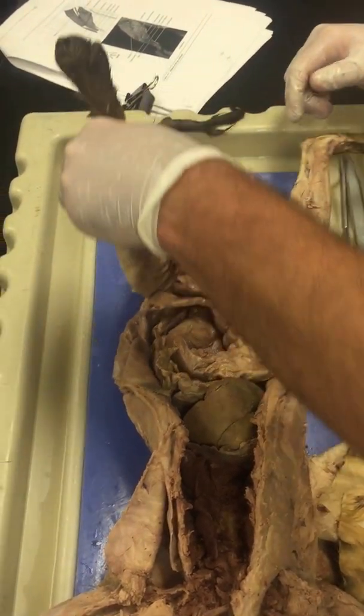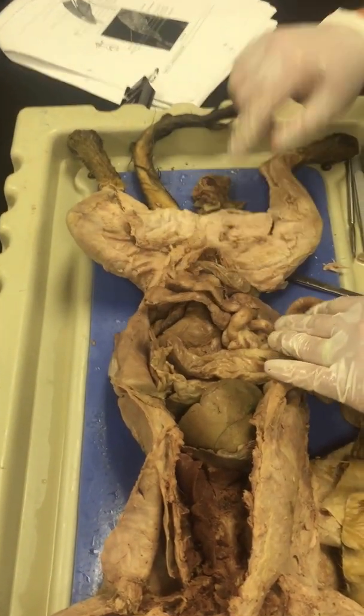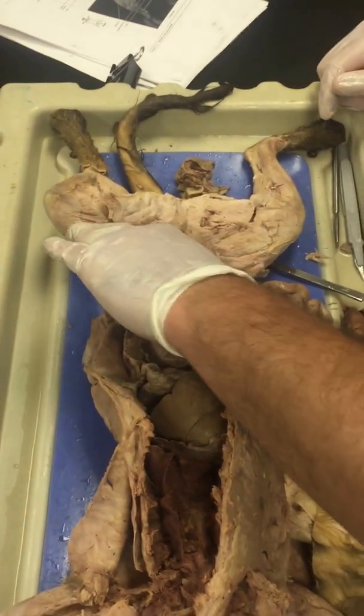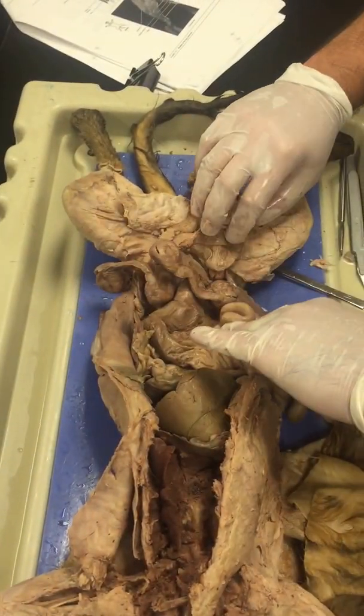anus, external sphincter, kitty litter box. Or if you're on the street, I guess, streets of Canada. Okay.